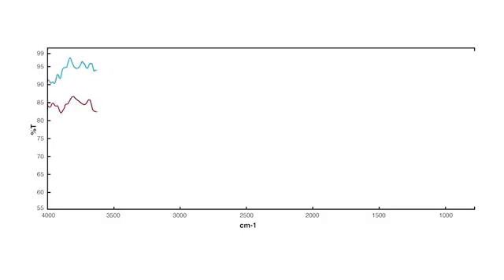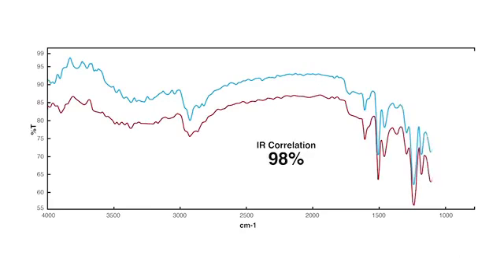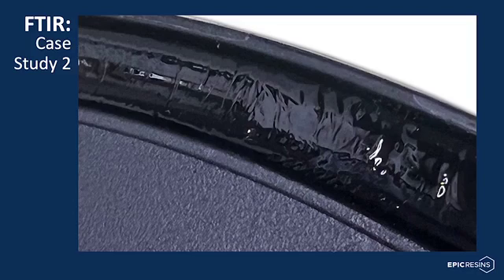When we overlay the two IR spectra and measure the statistical correlation between the peaks, we find a 98% correlation between region 1 and region 2, indicating a high probability and minimal difference in the chemical functionality of the two regions. The second demonstration of the utility of the ATR microscope was an instance where a customer was observing inconsistency on the surface of their potting material at the completion of their curing process. The image here shows what the customer was observing.